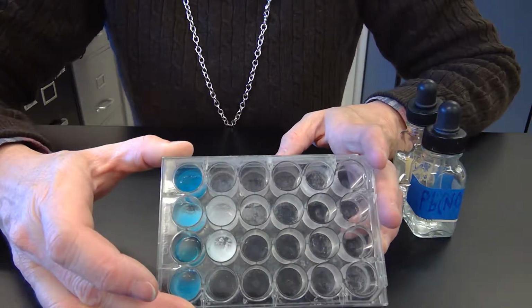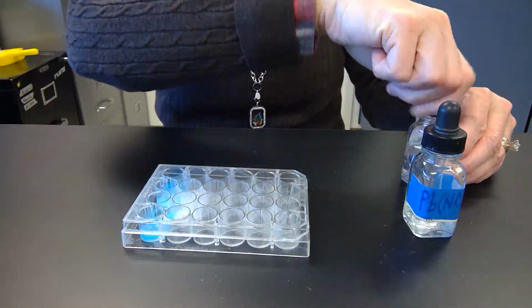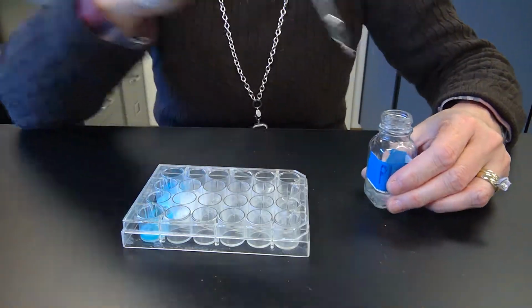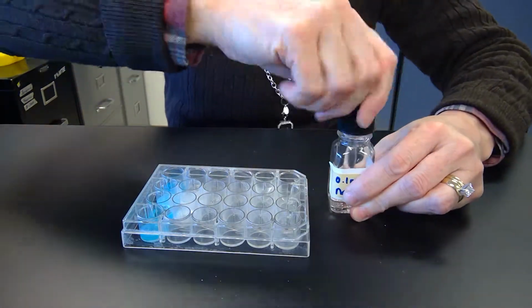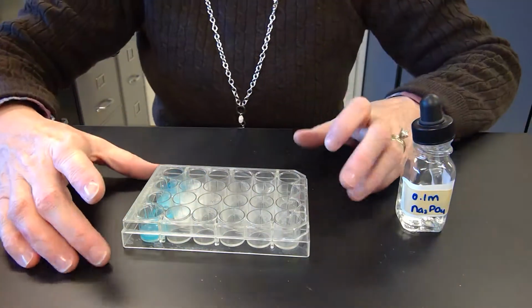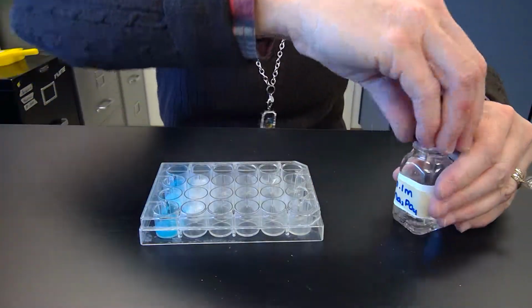The more it sits, the better it gets. So that's potassium chloride. And then we have lead 2 nitrate, the third one, and then sodium phosphate. We have our clear, then we add this clear, and that is an obvious reaction. So that's a positive, good.